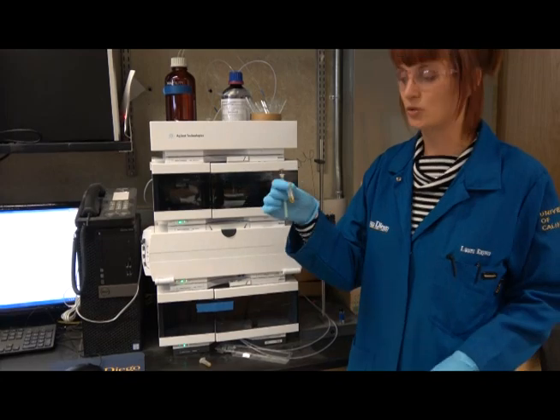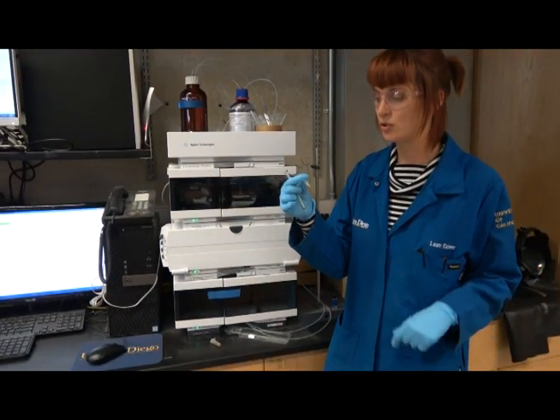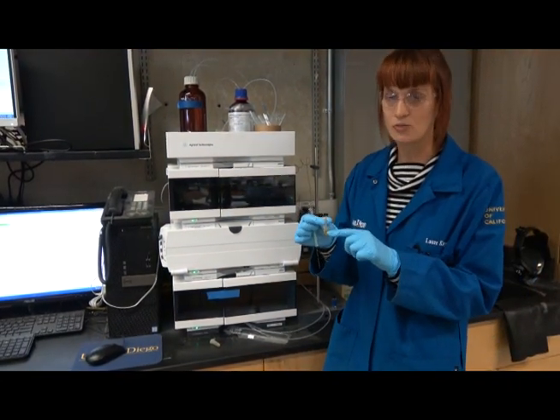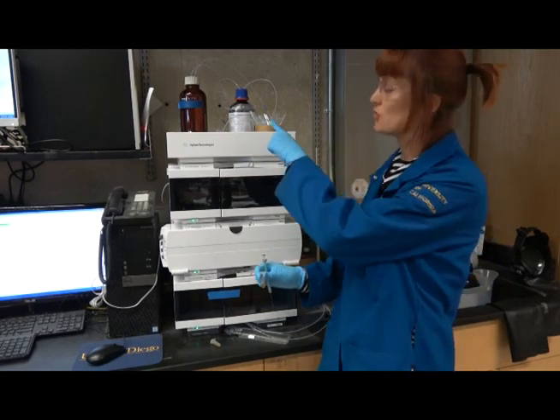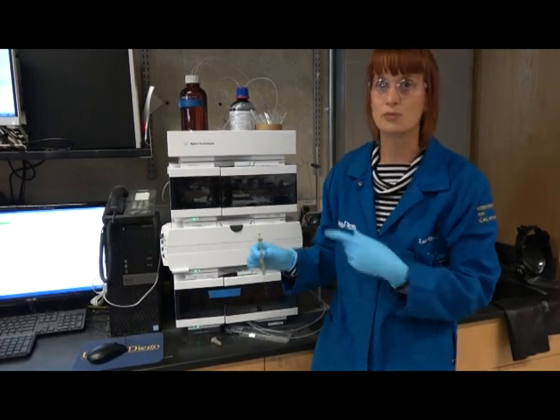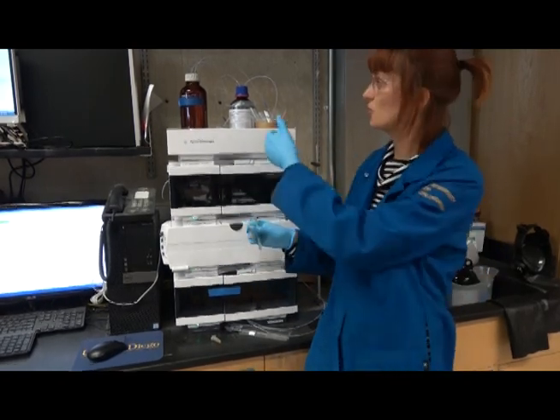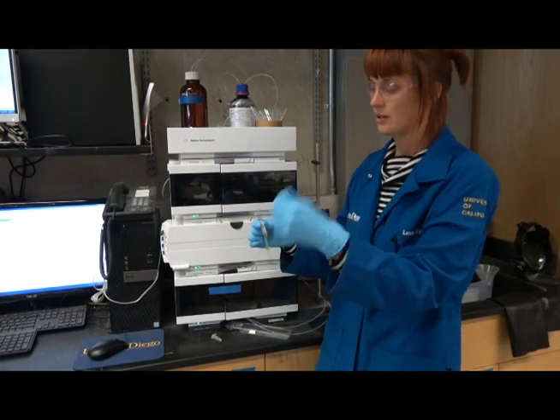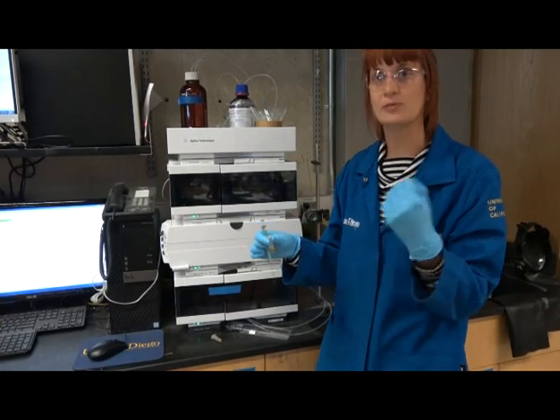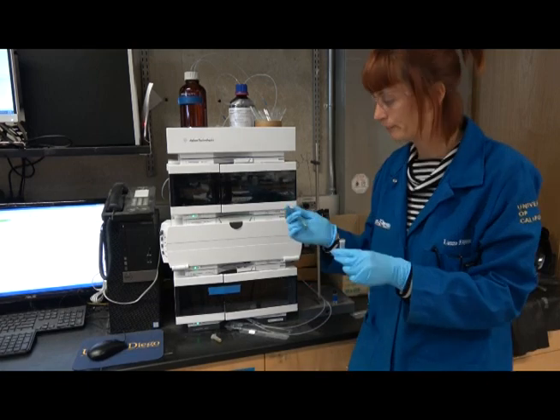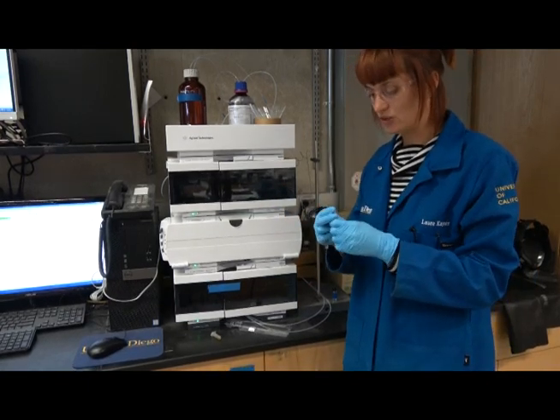again, the sample has been filtered through a 0.2 micron filter, and the solution that we use for this sample is the exact same buffer solution as the one we're using for the solvent. So you take some of the solvent out, dissolve your polymer in it, and filter it through the 0.2 micron filter.